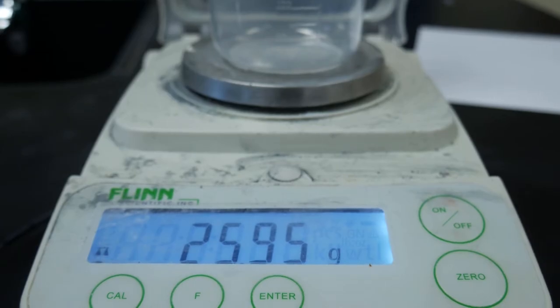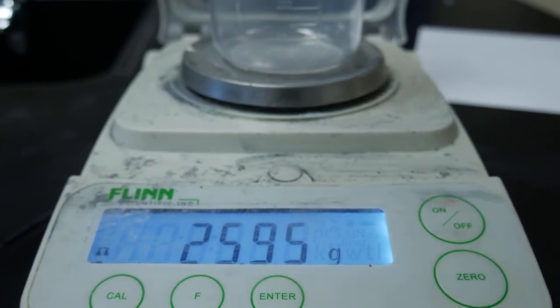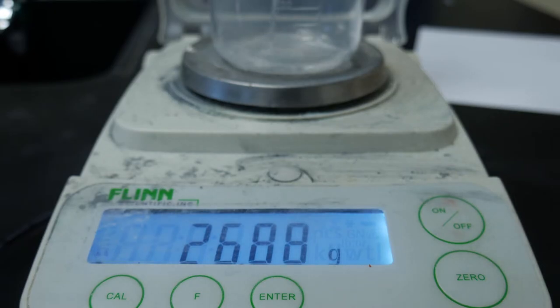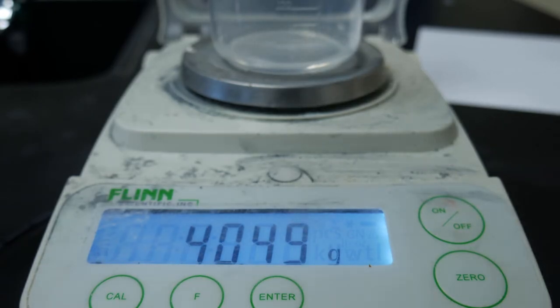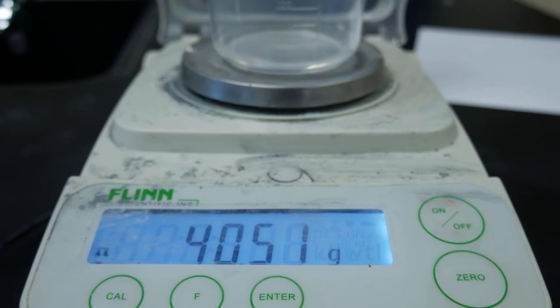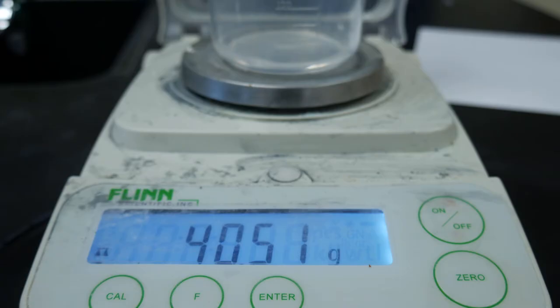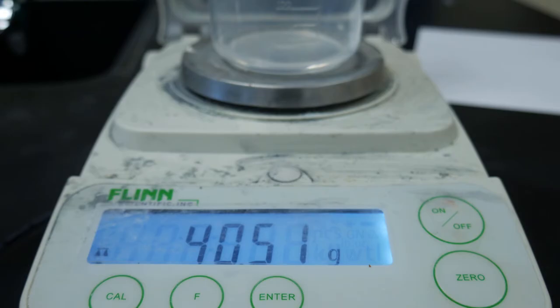Next, we're going to add 15 milliliters of vinegar to our beaker and record the mass of the beaker and vinegar together. The scale says 40.51 grams. Please record that number on your data table in the beaker and vinegar column.